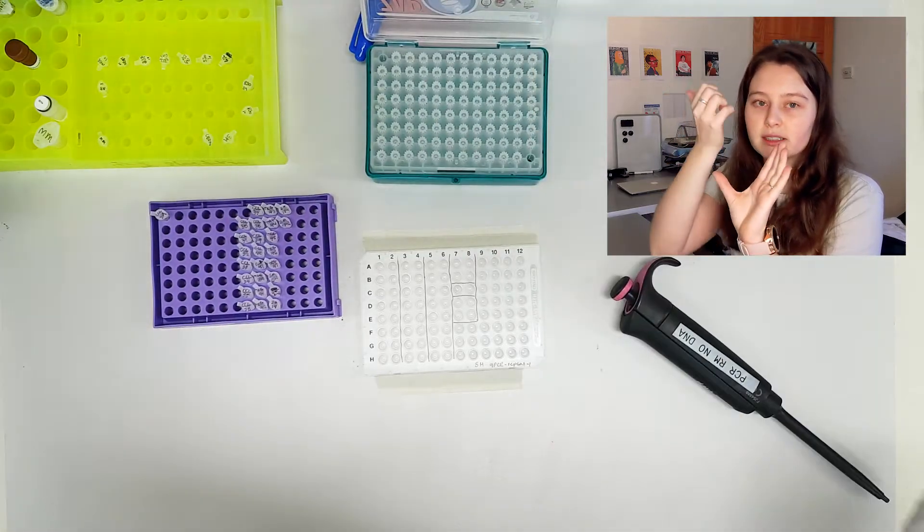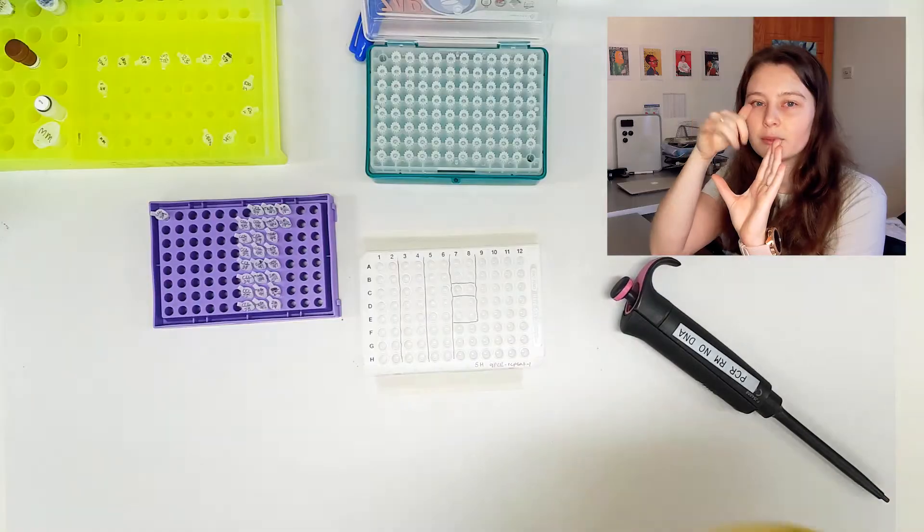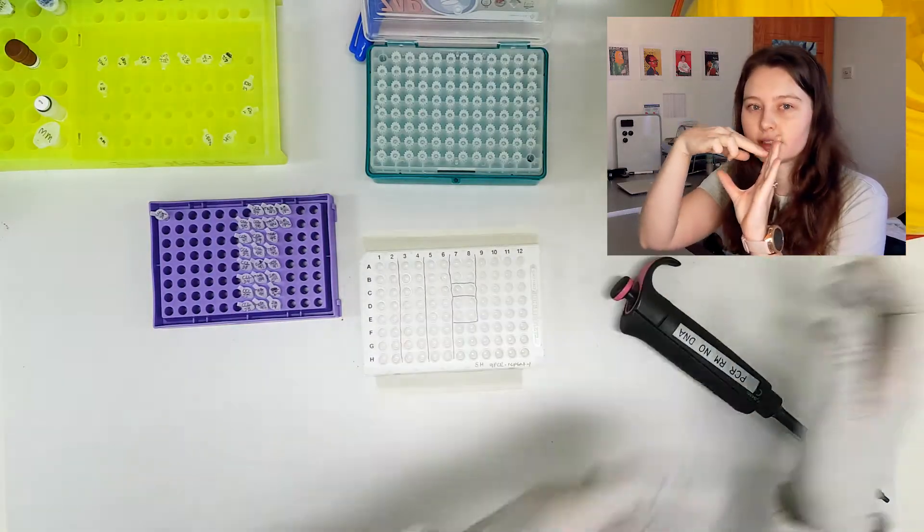So I'm going to pipette, instead of the master mix which I just pipetted down into the bottom, I'm going to pipette the sample onto the side of the well there.